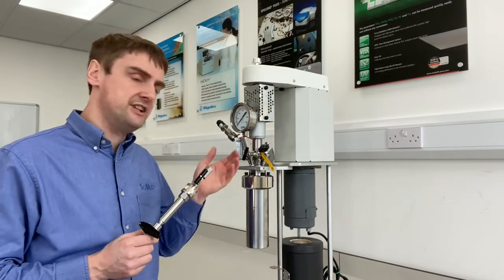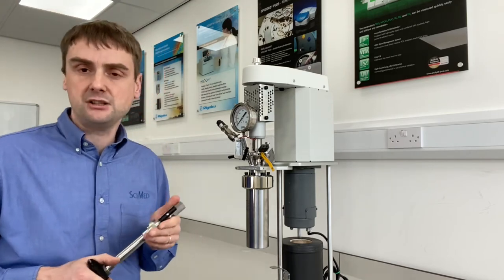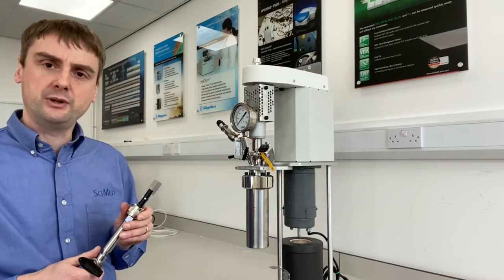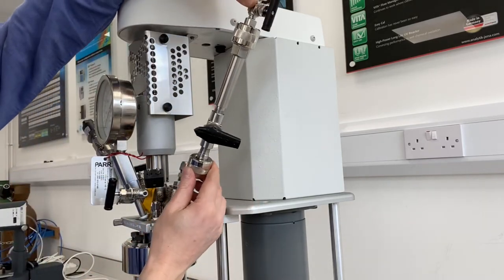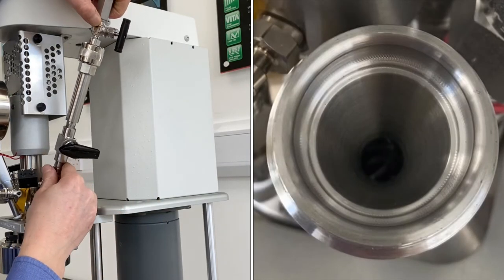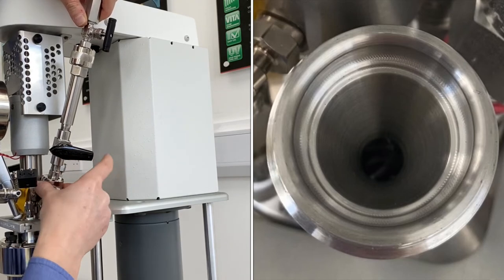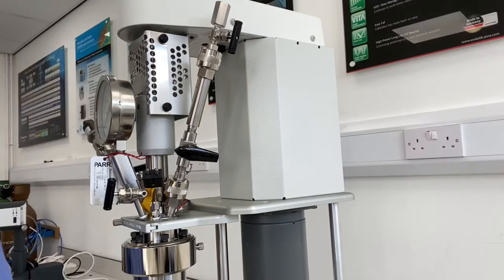So now what I will do is add this to the pressure vessel. This pressure vessel is a 600ml fixed head vessel from the mini range. You bring your XCAD with the catalyst inside it to the reactor. You have this large orifice port on the top of the vessel head. You place the XCAD on top and with the hand tightening closure you screw it on. That's it — now in place and ready to go.